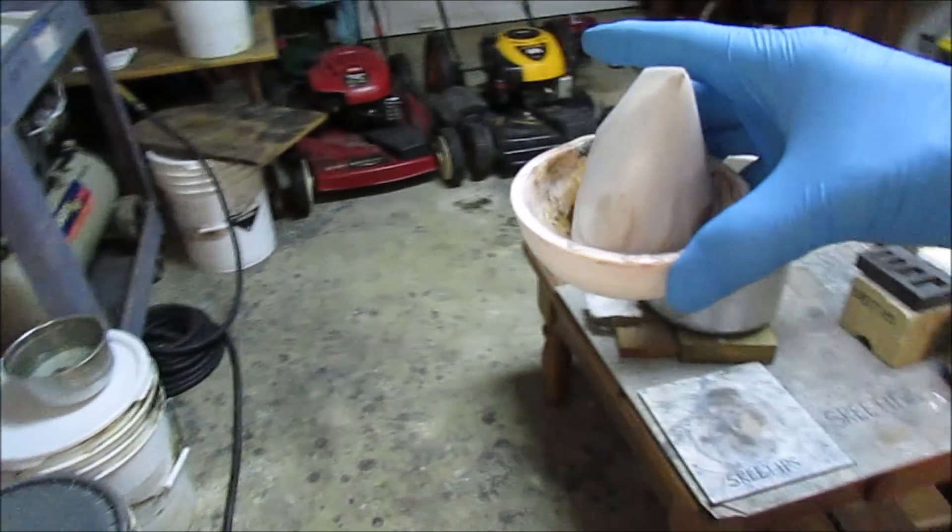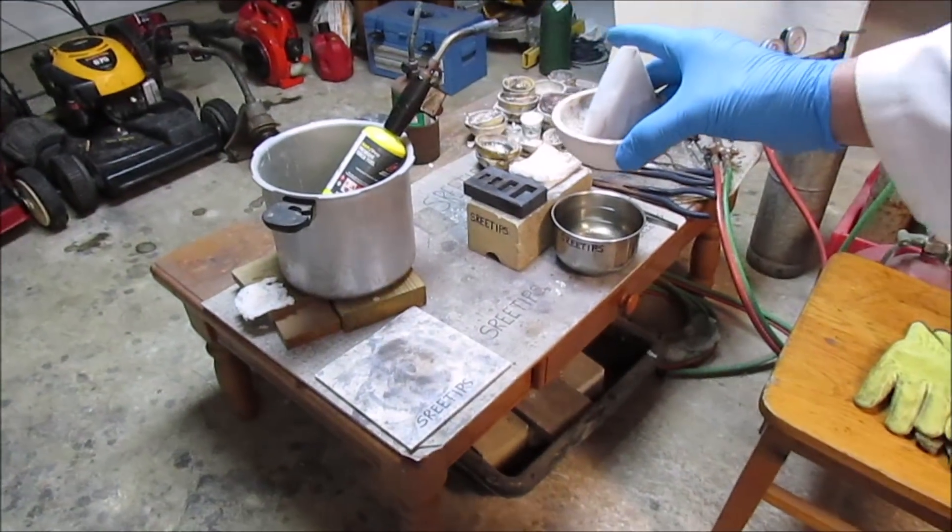Wow, it's in the melt dish here, and we'll put it down here on the table.